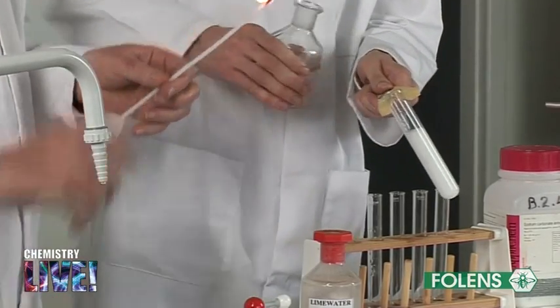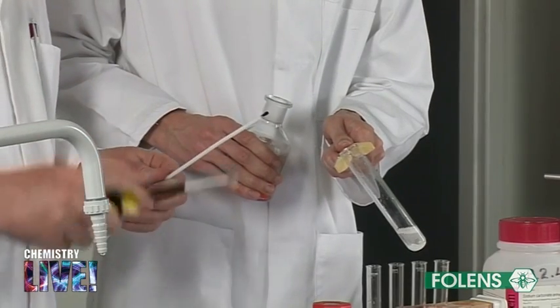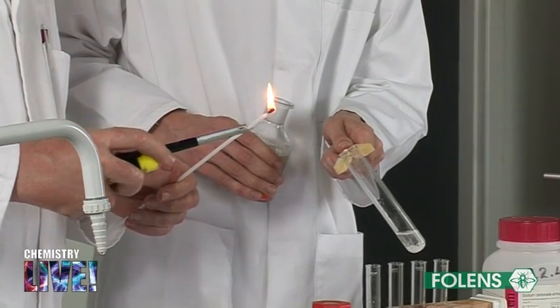Note that fizzing takes place. If a lighted taper is brought near the mouth of the test tube, note that the taper is extinguished.